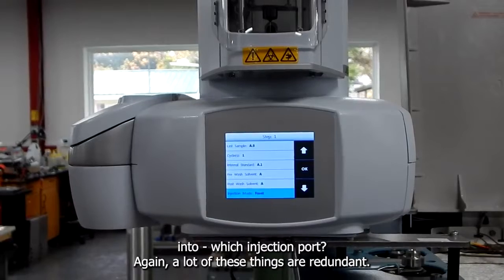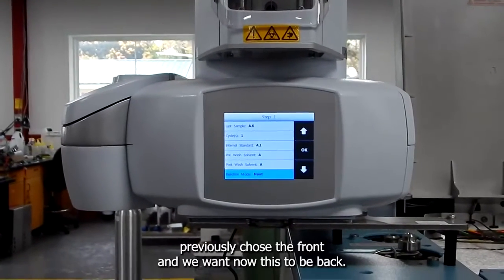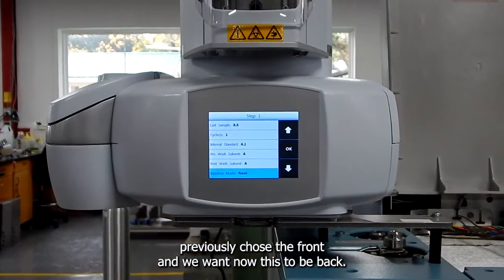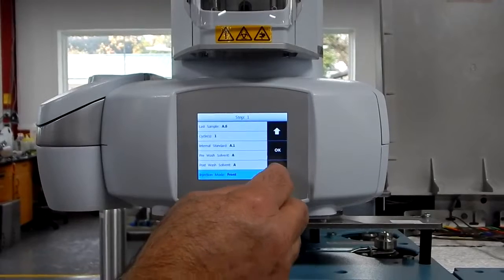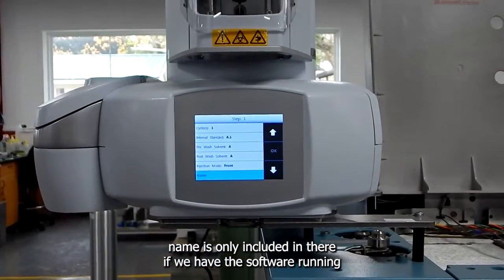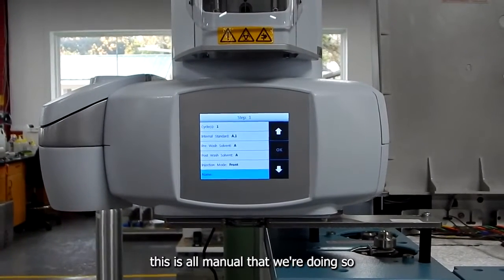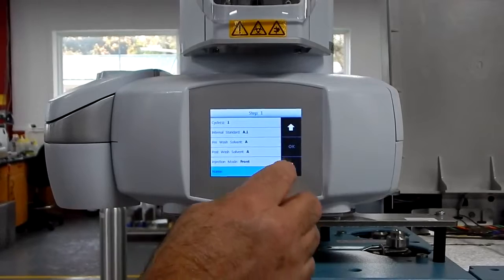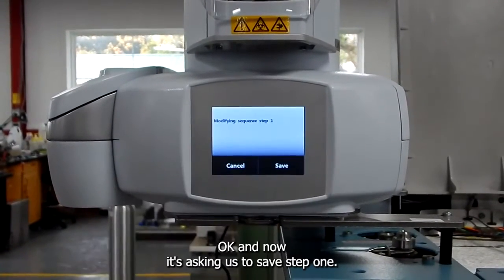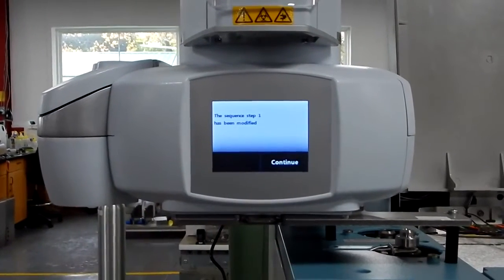Again, a lot of these things are redundant. I don't know what happens if we previously chose the front and we want now this to be back. Would it go to be back? I'm not sure at this point. Name is only included in there if we have the software running. This is all manual that we're doing, so we put nothing in there. Then we hit OK. Now it's asking us to save step 1.